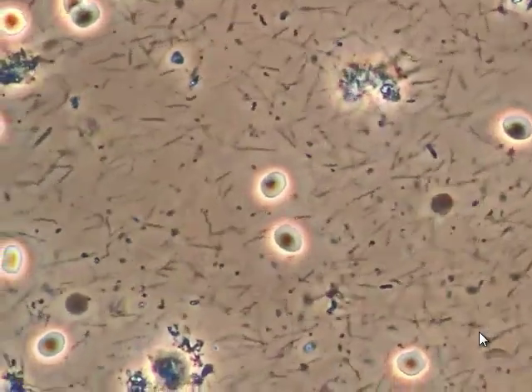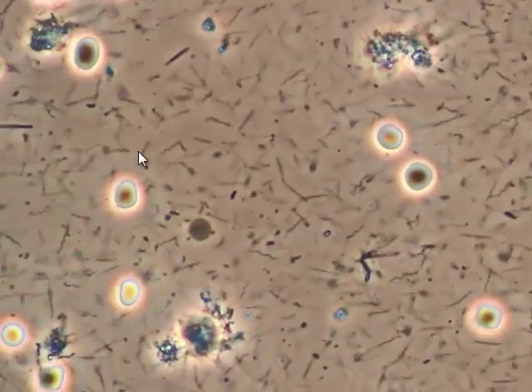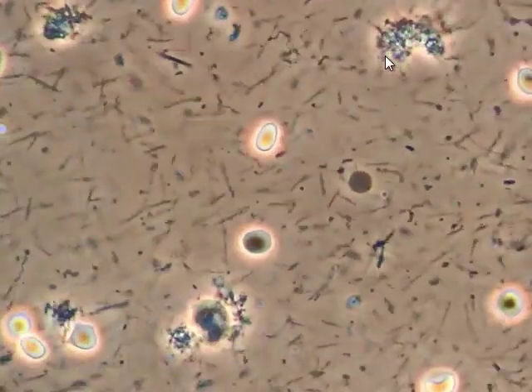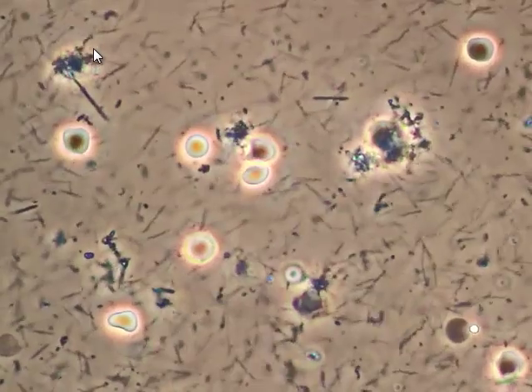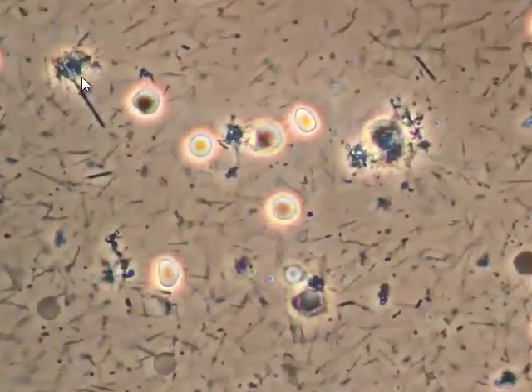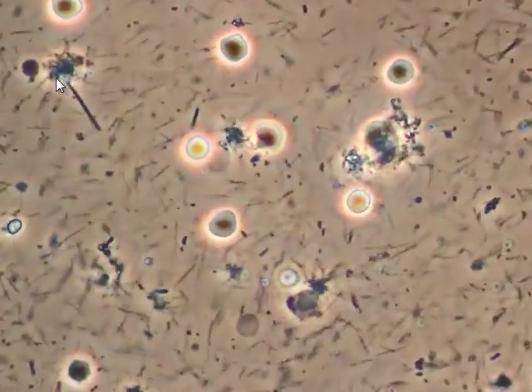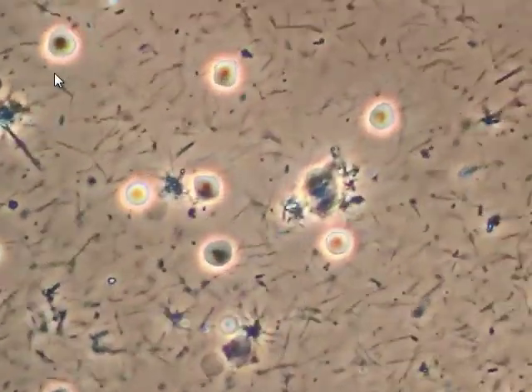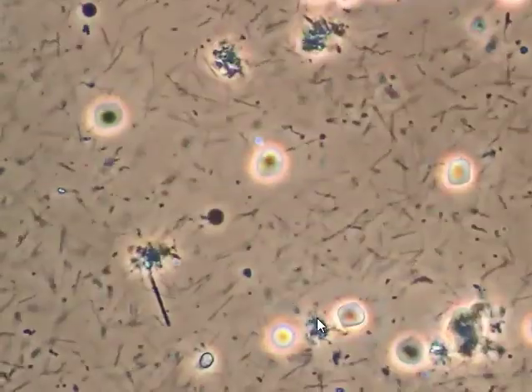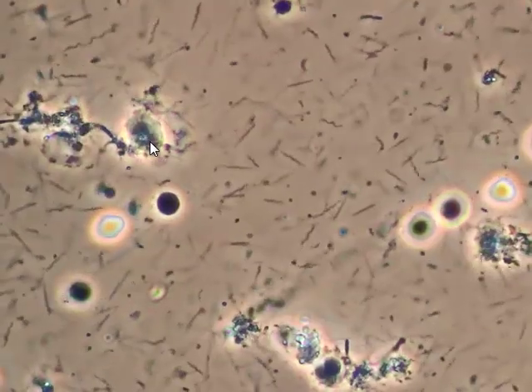Dr. O'Reilly here. We have a plaque sample of spirochetes in this slide, where we're looking at spirochetes attacking different cells. You see this area here — this is an old white blood cell that the spirochetes are actually eating and attacking. You can see how the cells are being moved around by the bacteria as they're feeding on these cells.